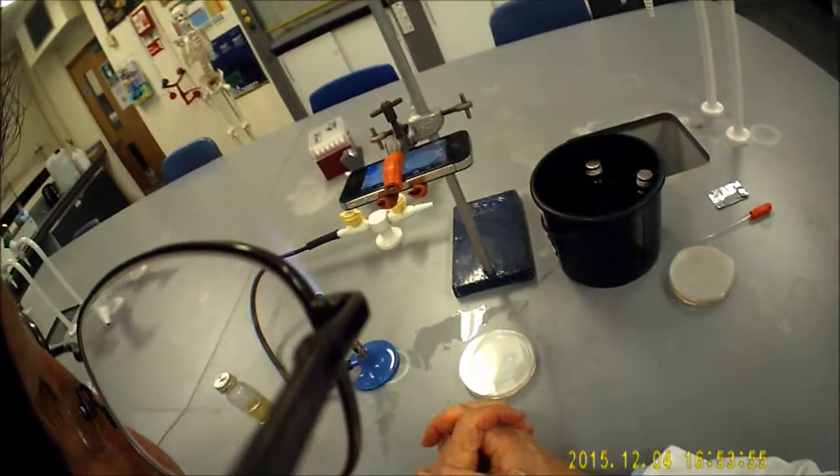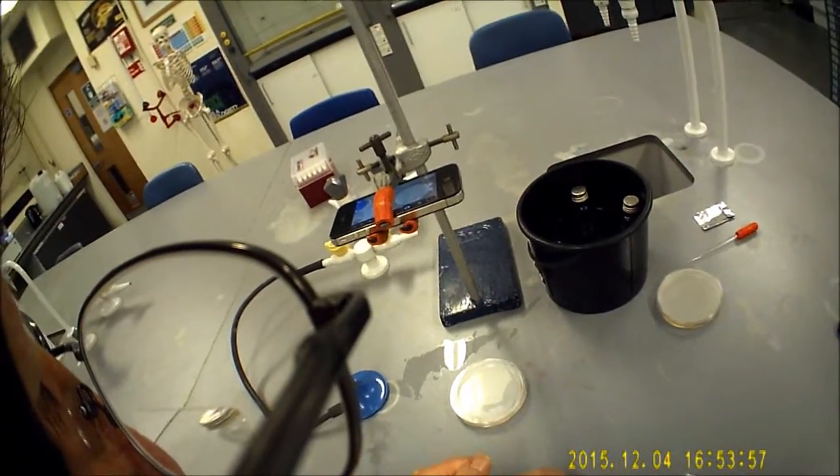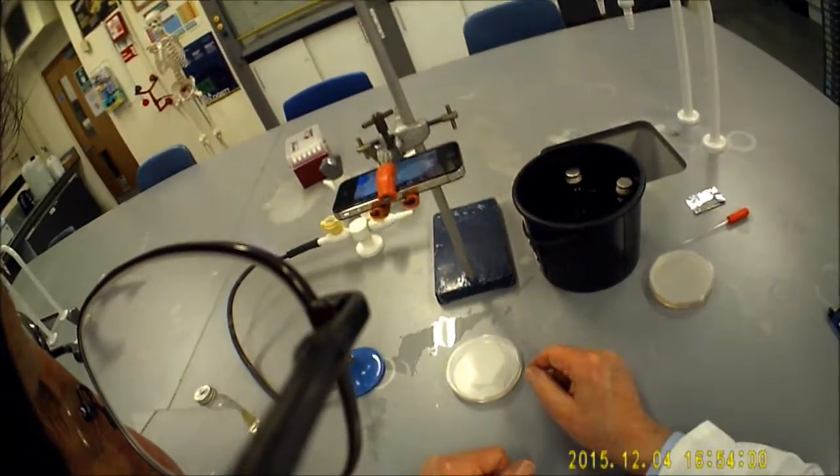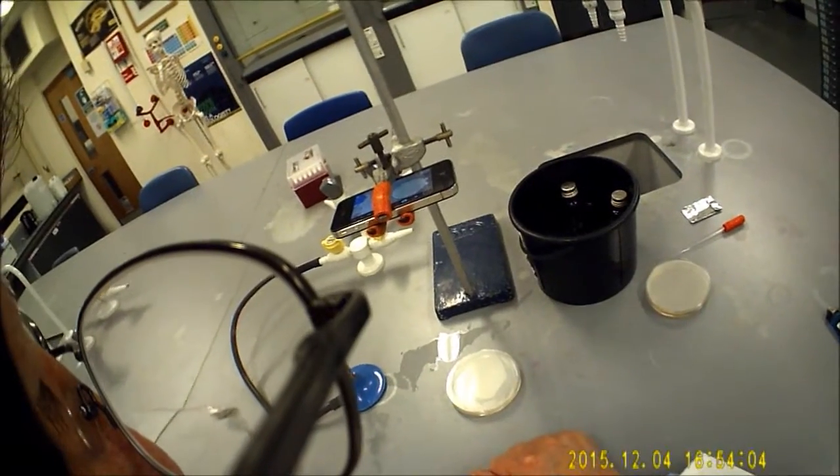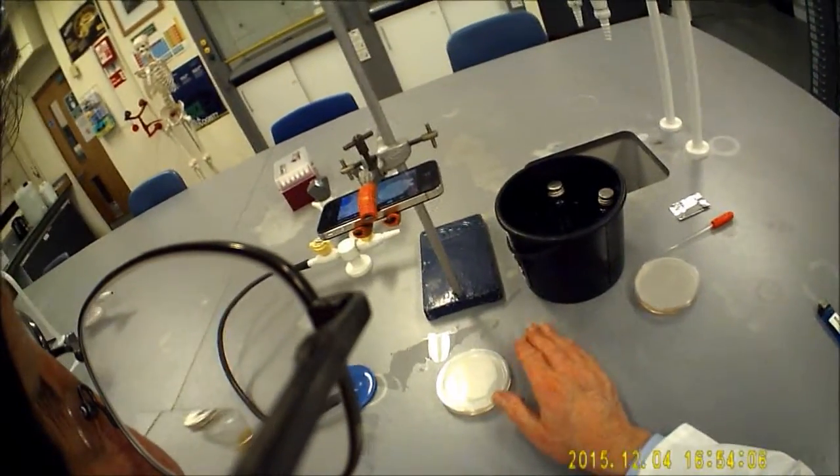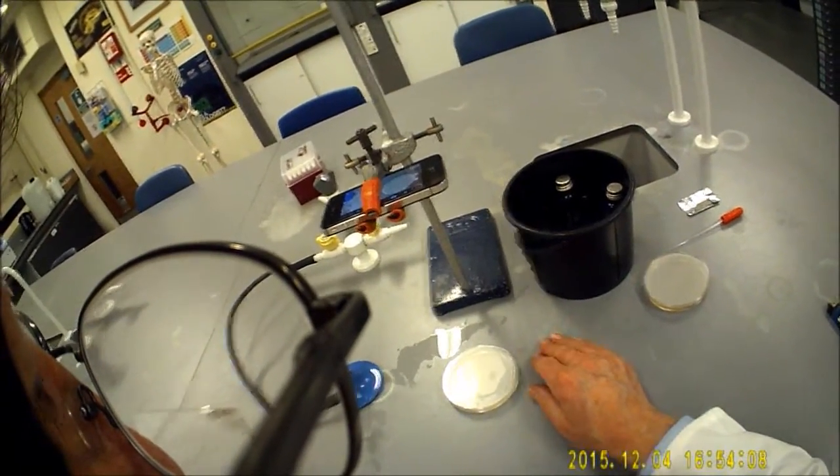If you were doing a continuous succession of plates, I'm only doing one, what you could do is use one and a half in each plate. So three bottles of agar would do two plates.